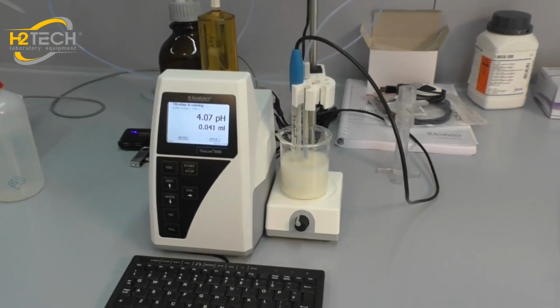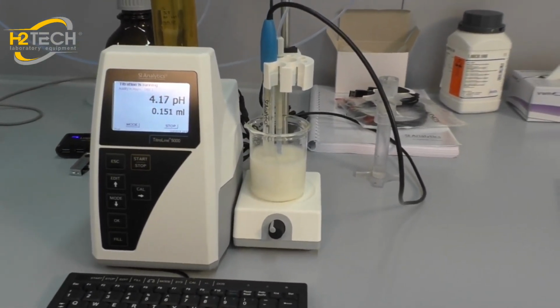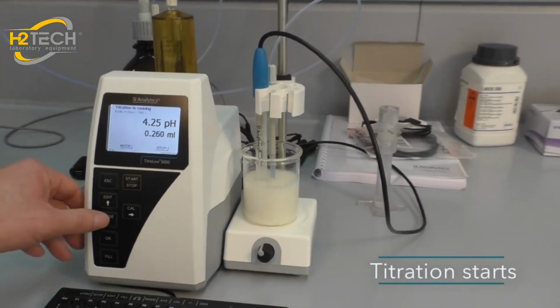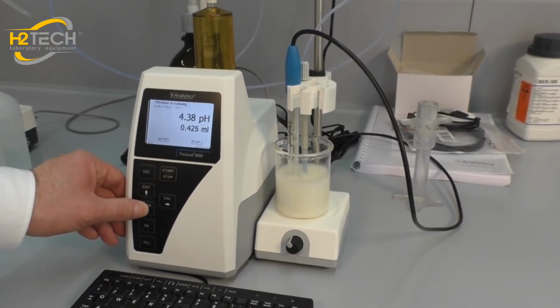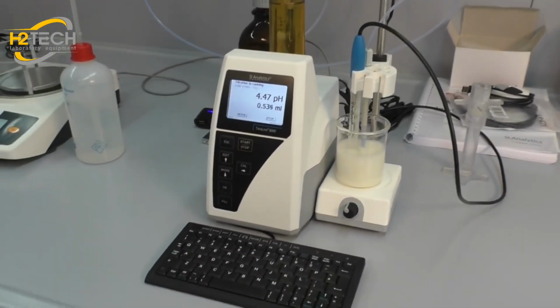After the mixing time is finished, the titrator automatically starts the titration. With the mode or F5 key you can toggle between the graphic display or the titration values in pH and milliliter.